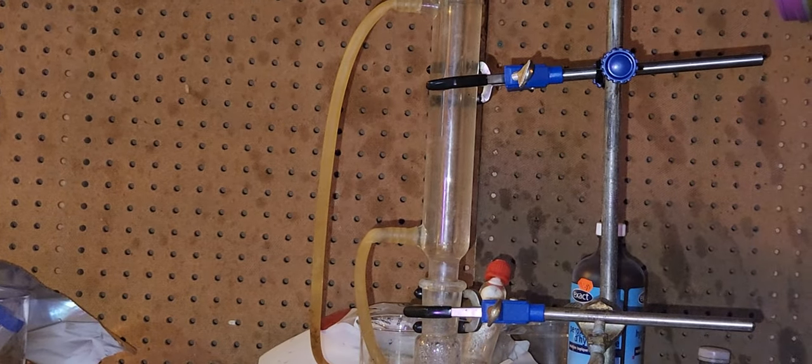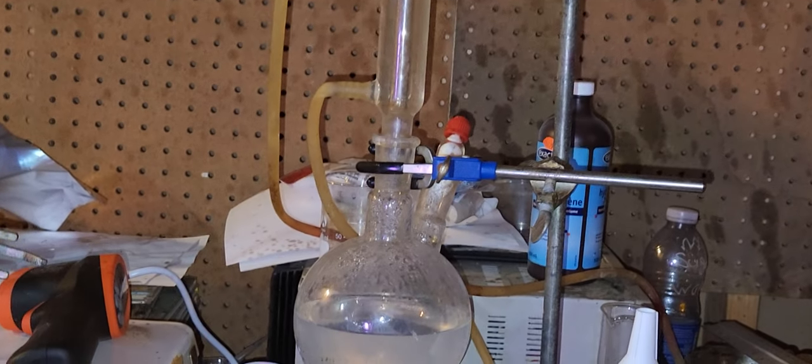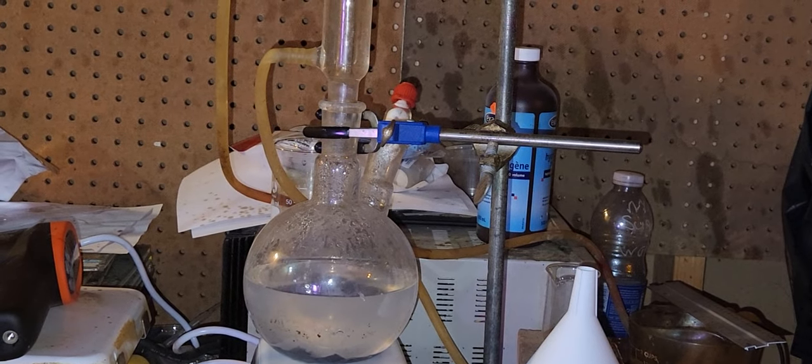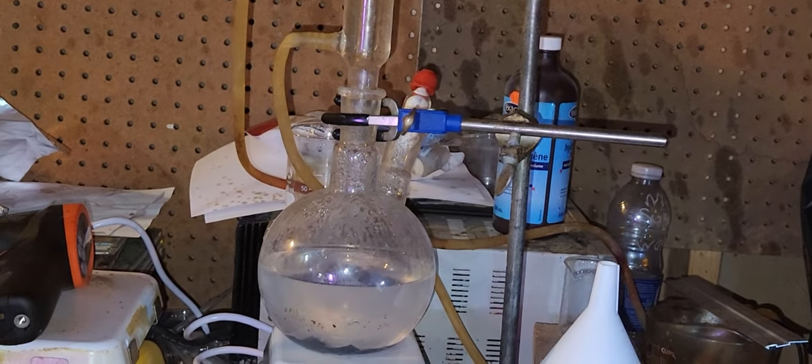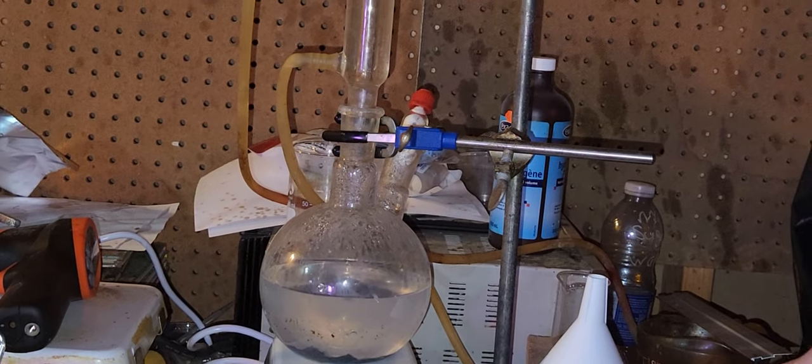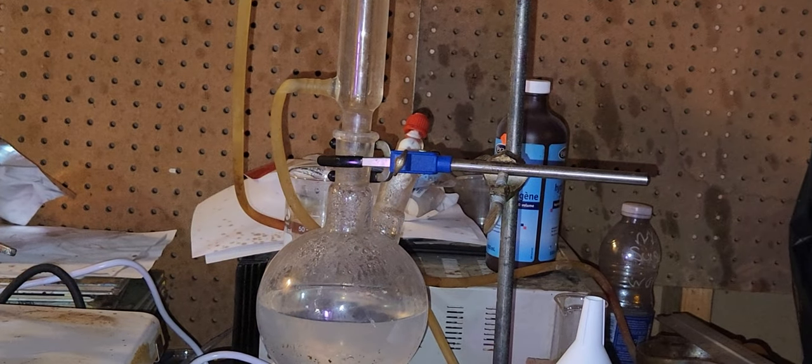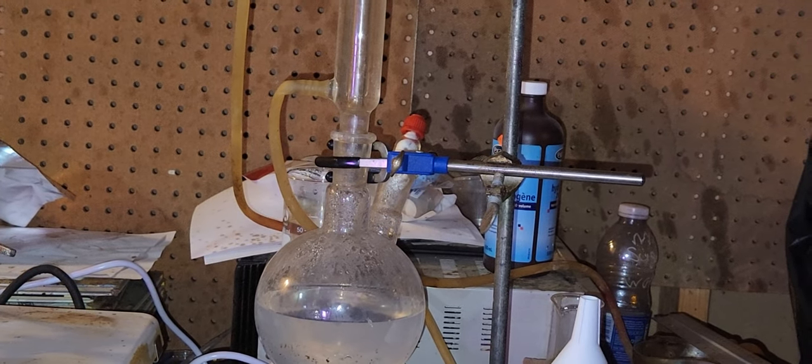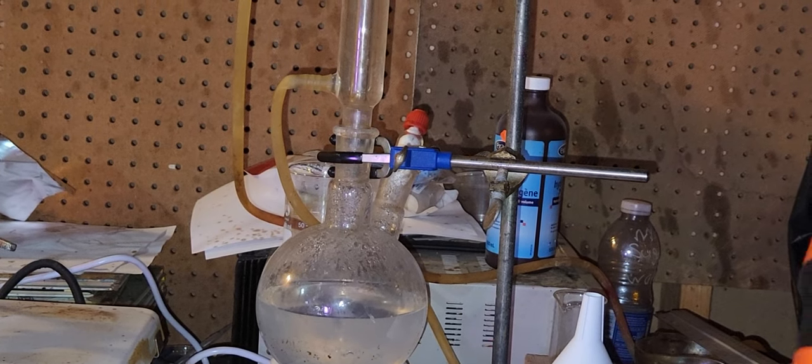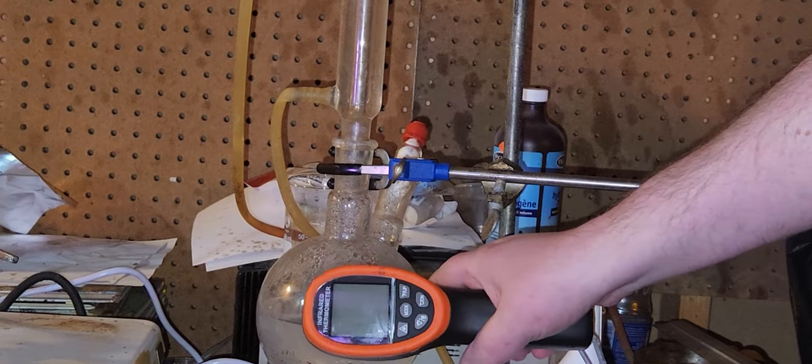It's a little difficult to use this apparatus, but as you can see, I'm trying to get lead acetate to adhere. I'm making lead acetate crystals using 3% hydrogen peroxide and 68 grams of lead, which should produce 121.4 grams of lead acetate trihydrate.